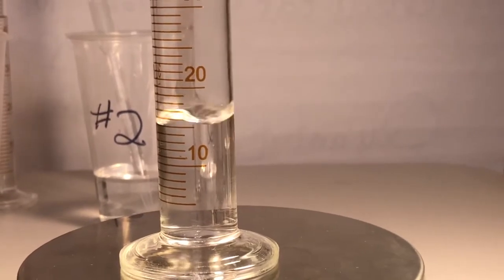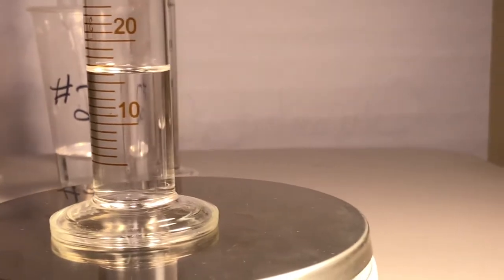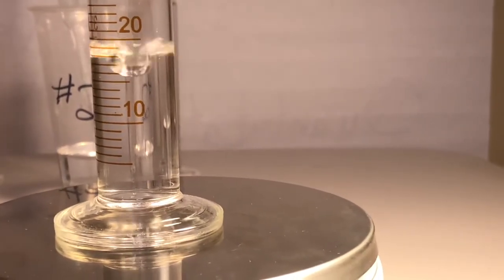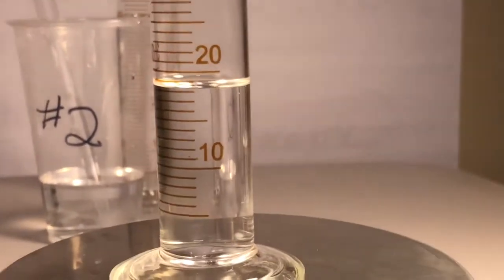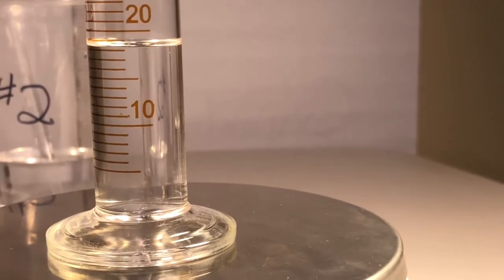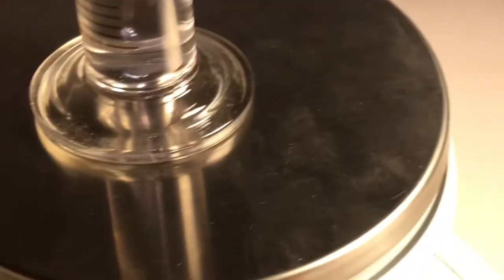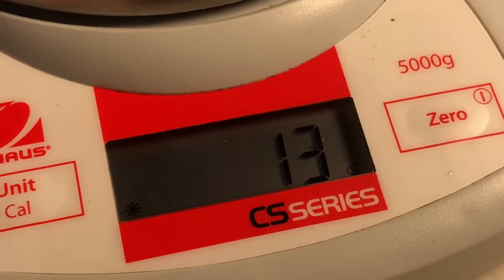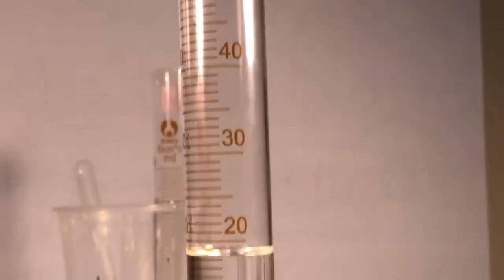Curse splotch. And a half of a splotch. Well, I give you a whole splotch. All right, what you got? Get your eyeball even. Right there is even. Count them lines. That one's in the middle. You're gonna have to pick something. Cool. And here comes a mass. I think that was 3, right? Here comes 4. 4 for 4.